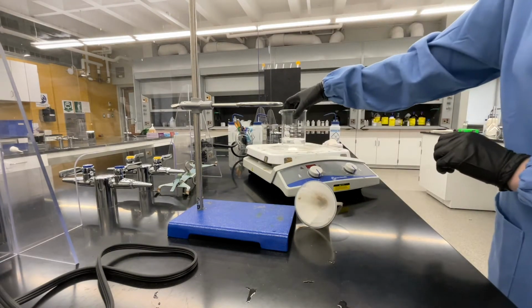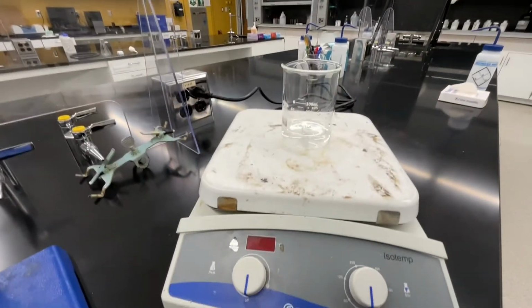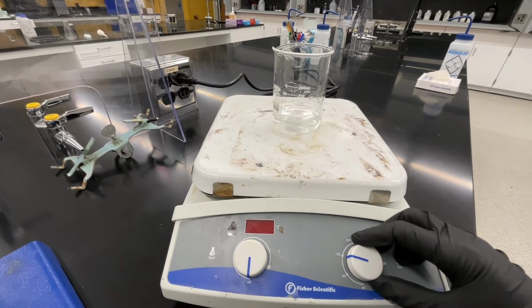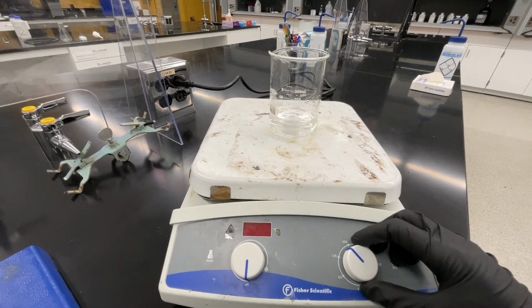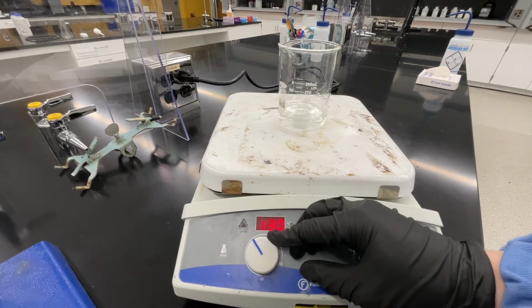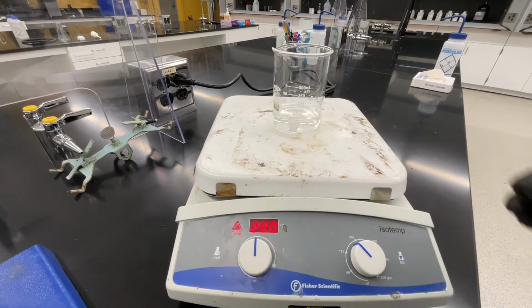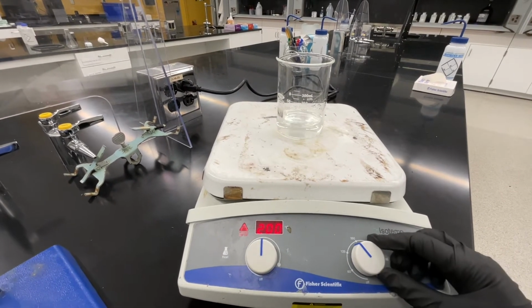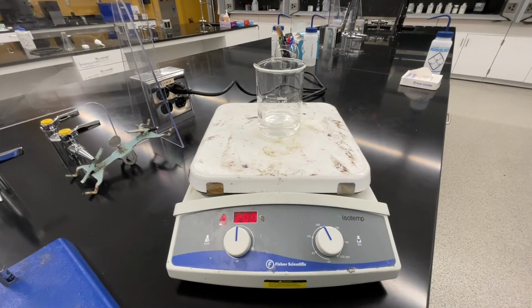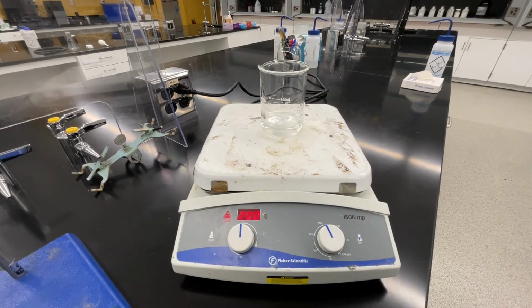You're going to place this beaker along with the stir bar and the solution onto a stir hot plate. Again, center your beaker and slowly turn on the stir until you have a good speed. You're also going to turn on the heat here. Our goal is to boil off all of the water in this solution, which will then leave behind the solid. Set the temperature of your hot plate to 200 degrees Celsius and let this reaction heat and stir until all water is boiled off. This can take up to an hour, so in the meantime, we're going to complete the rest of the experiment.